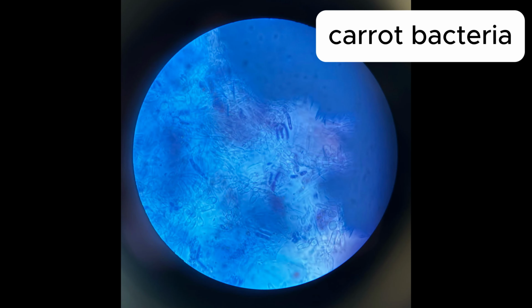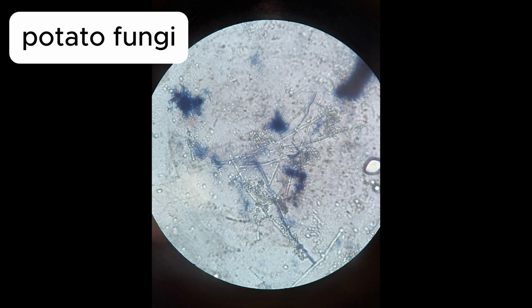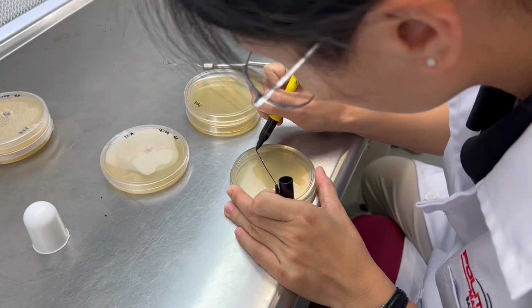The results observed for carrot and potato are as follows. Koch Postulate 3.